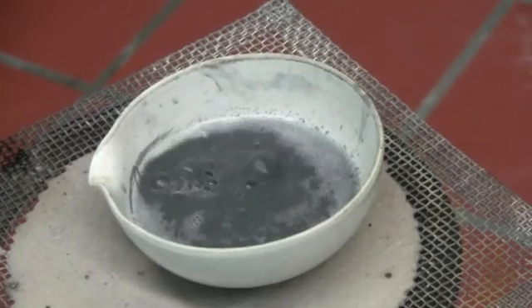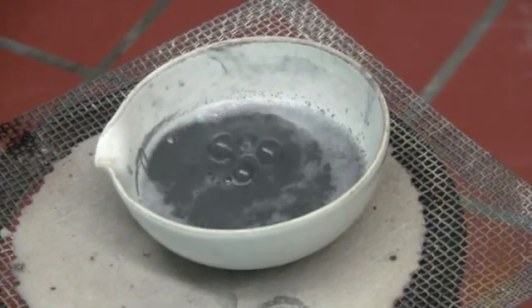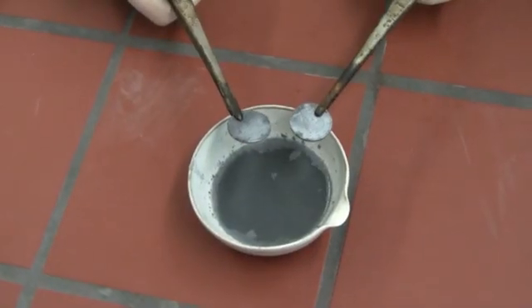We must be very careful because the solution is very corrosive. We clean the coins with water.